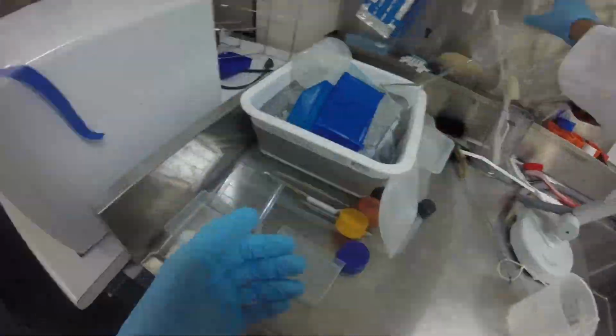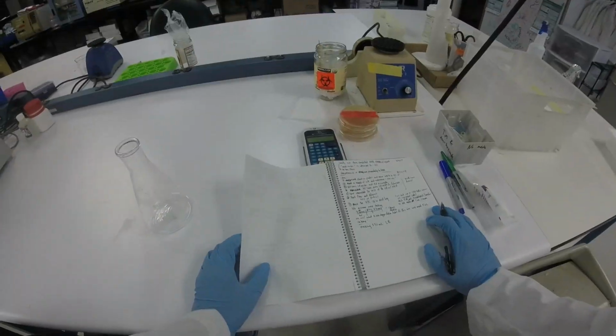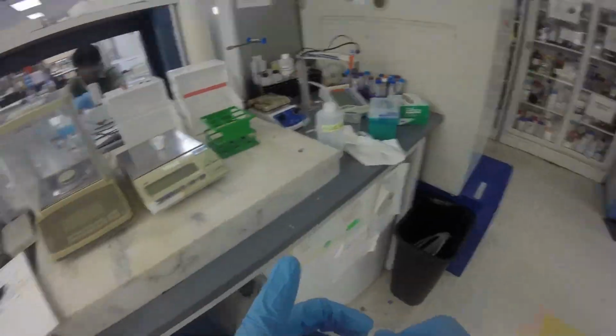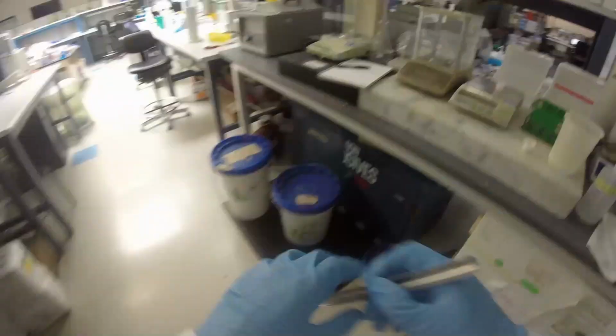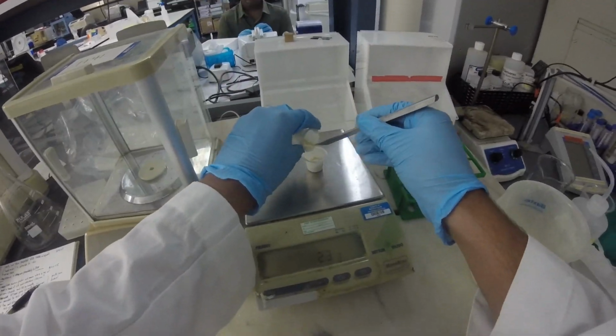And that's super exciting because 2 days ago, or well, I plated them 3 days ago, but then I came in 2 days ago and I saw basically no growth and no glowing. And I was like super bummed. I thought it didn't work. So I was like, all right, I got to redo this whole thing. And I probably still will redo it, but it's really exciting to see these colonies.